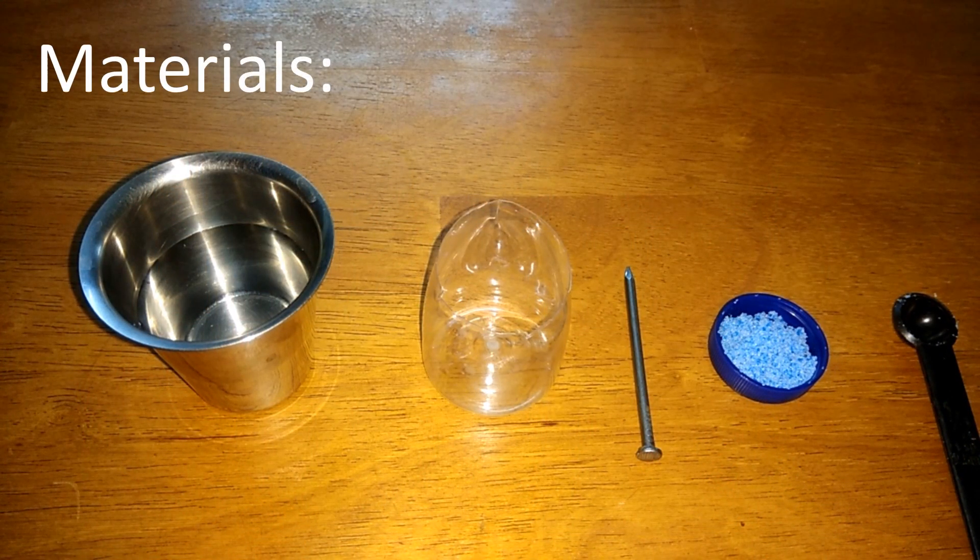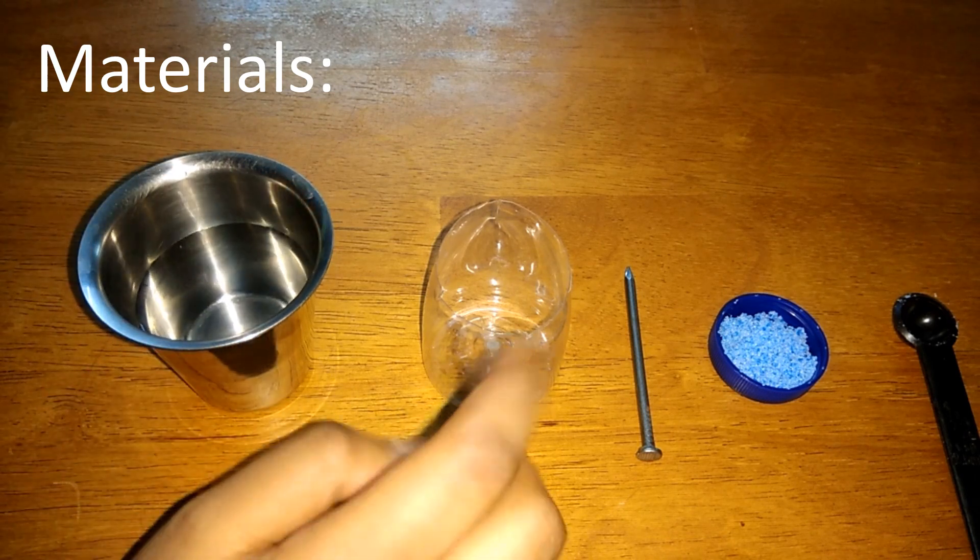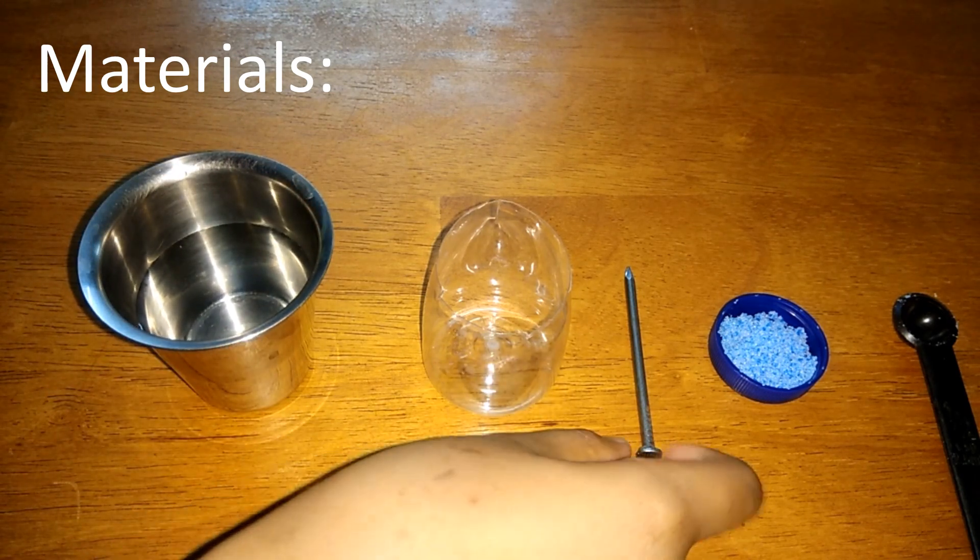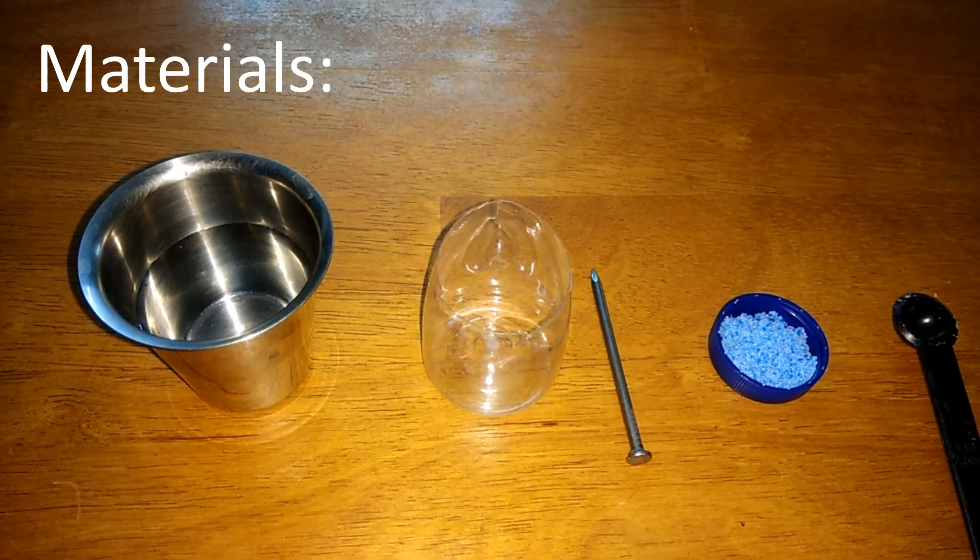So, for this experiment, I will be using some water, one plastic container, one iron nail and some copper sulphate.